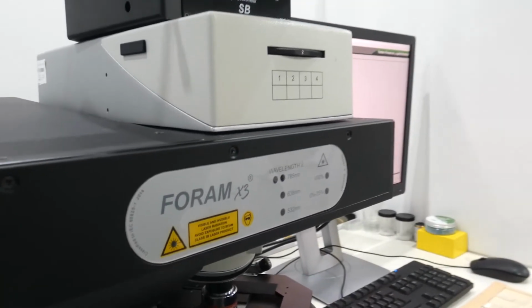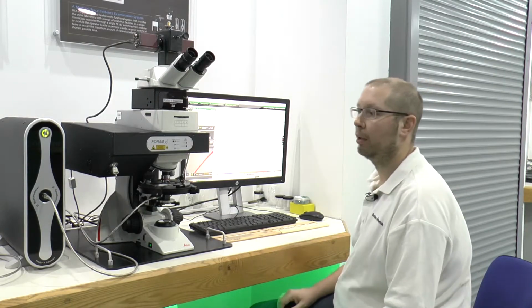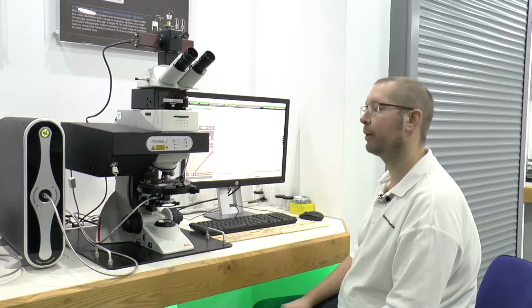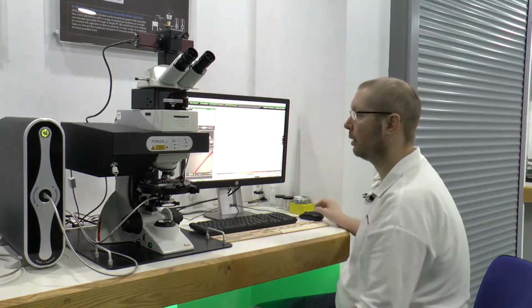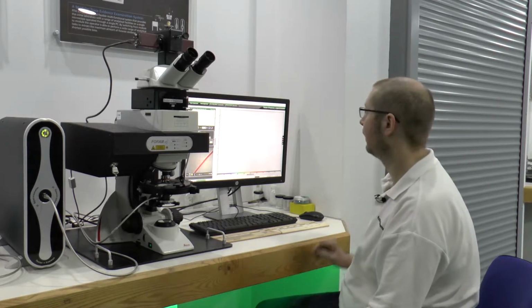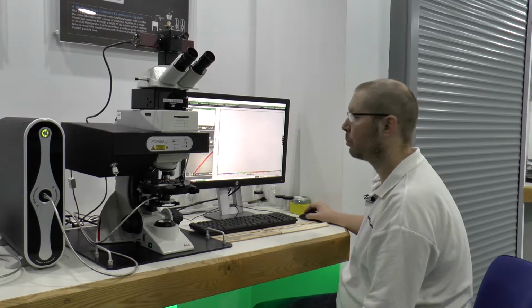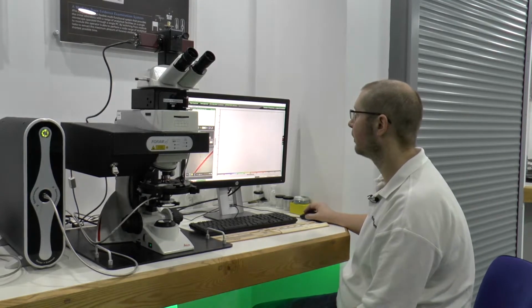Here we're going to take a look at the UV-Vis NIR microspectrometer. It records absorption and transmission spectra in the range of 240 nanometers to 1,000 nanometers. We have a fibre here mounted on a quartz slide in glycerin, and we're going to use this system to take some absorption measurements of these fibres that are recovered from the crime scene.